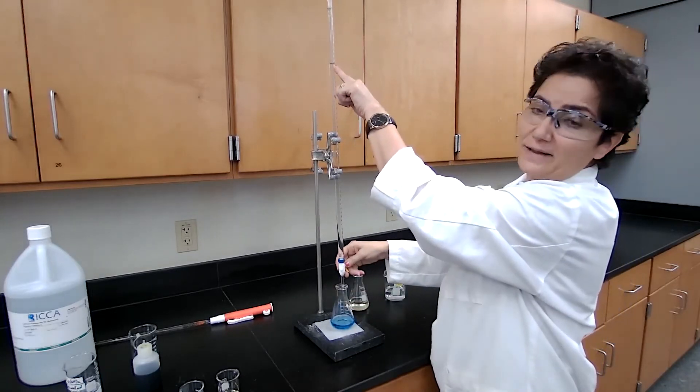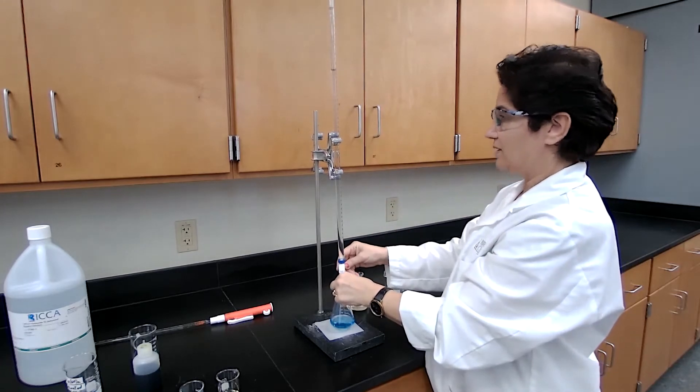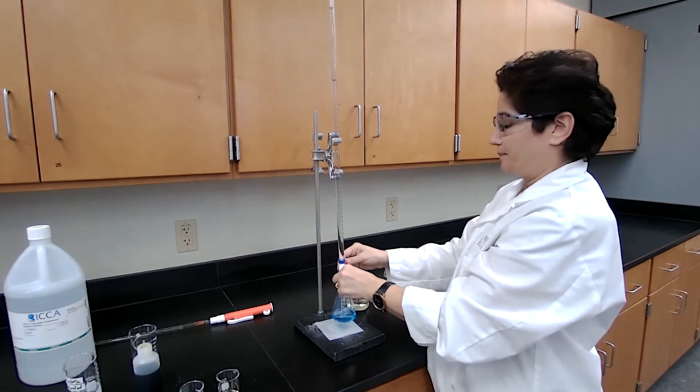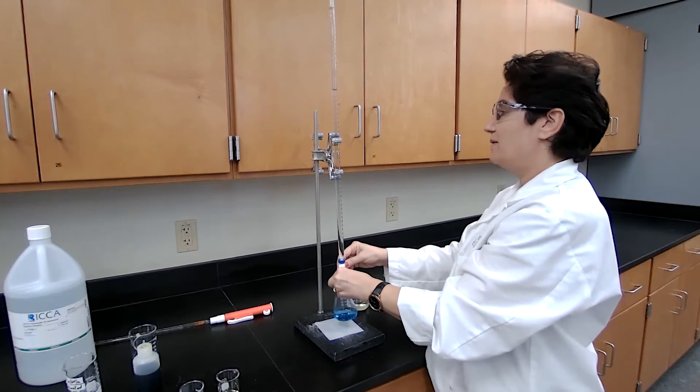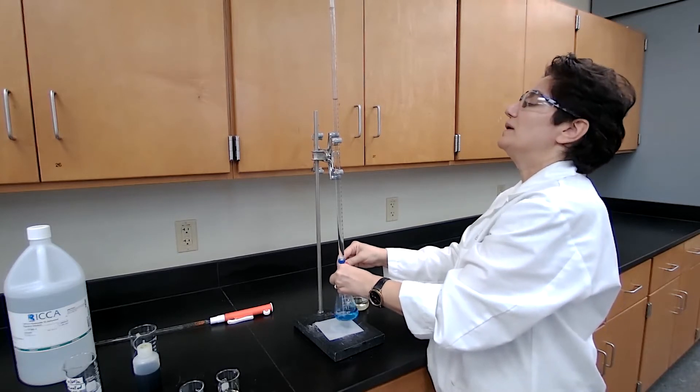I'm starting from 10 point zero zero. We can add about 20 milliliters and then I will slow down.